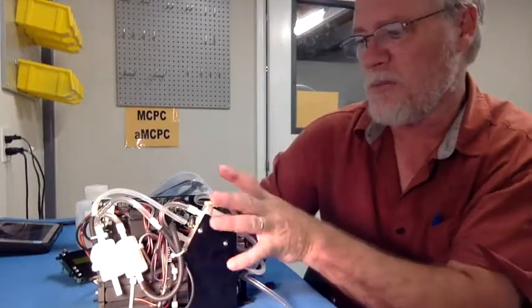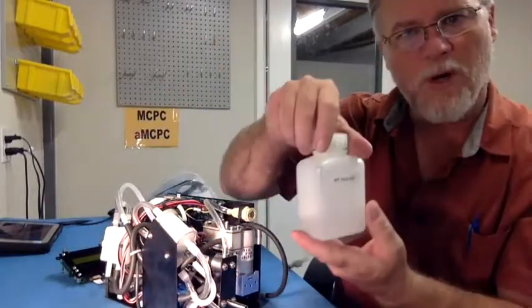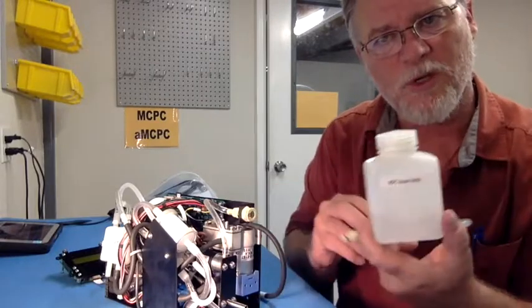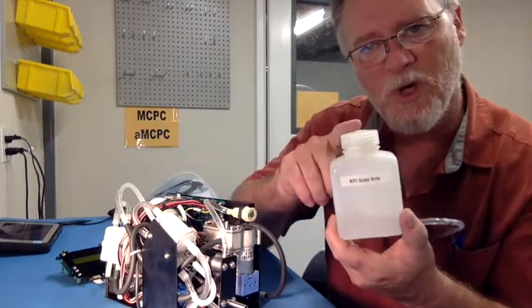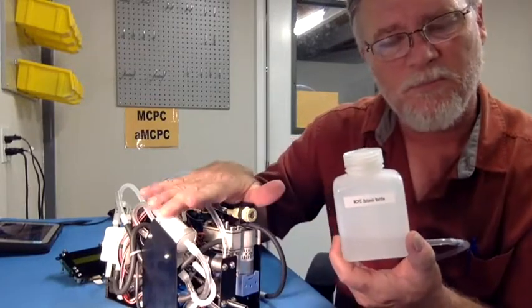That's where the liquid butanol enters when you connect the butanol bottle that comes with your unit to the fill connector. That's how you fill butanol. Your unit will arrive dry, so it will not count particles until you actually add liquid butanol. You want to use reagent grade butanol for this unit.